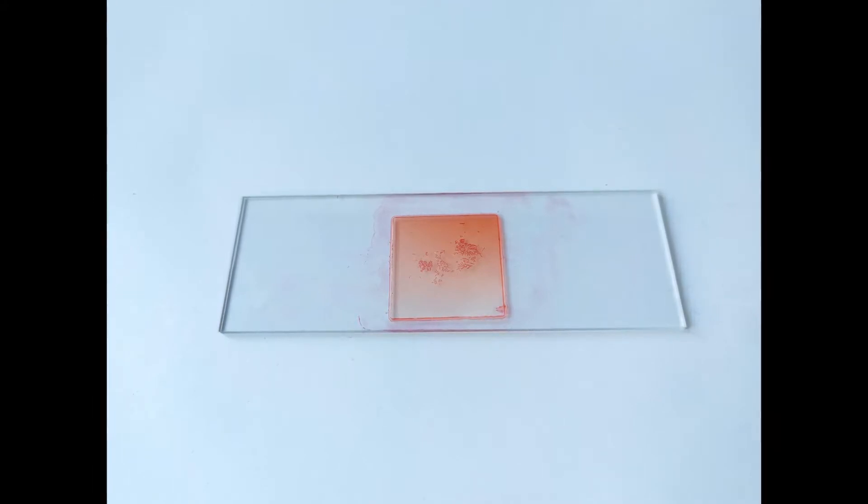So let's get started. First off, gather the materials required for permanent slide preparation.